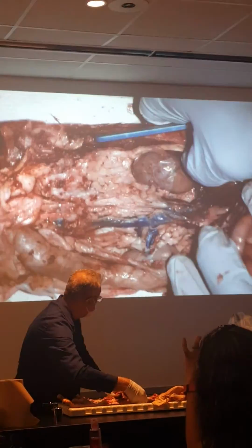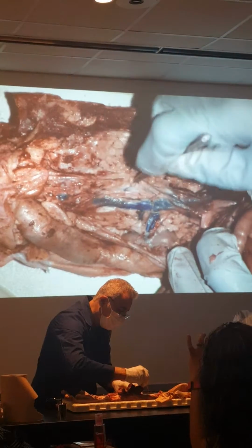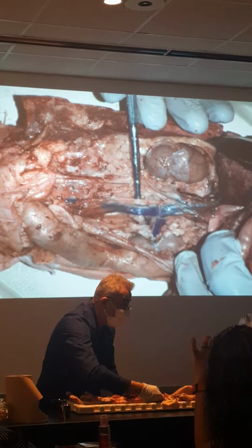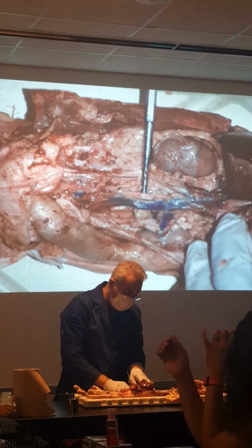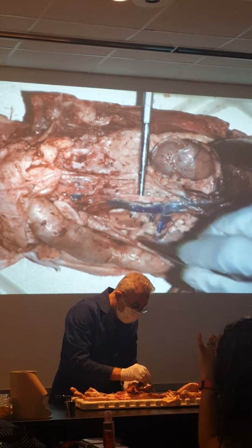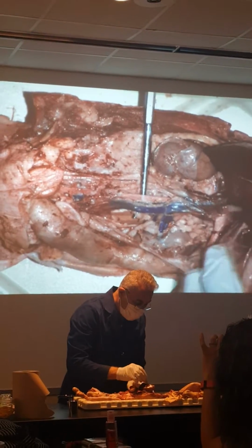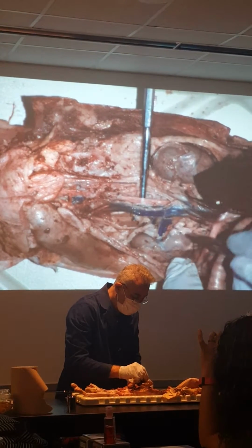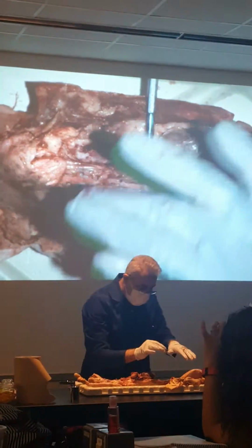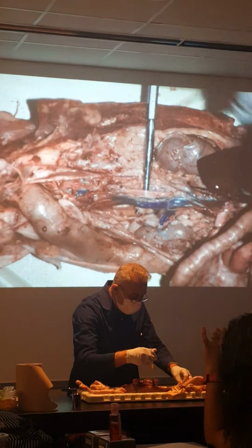I have to do a lot of digging. We are following the aorta. Remember abdominal aorta and abdominal vein. They run parallel to each other. Everyone? This is the aorta. This is the vein. Remember, both of them hit the kidney, right? Over here? Okay, renal.